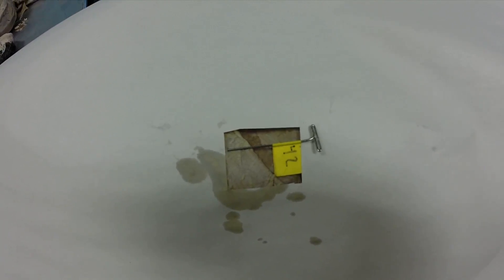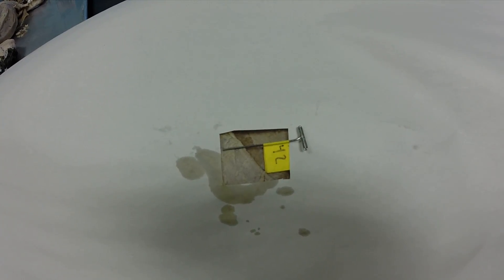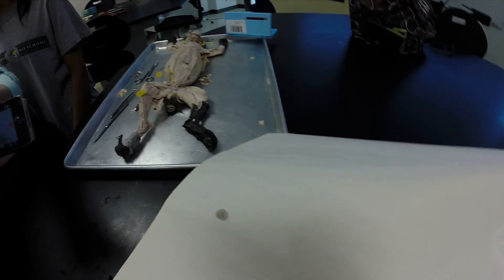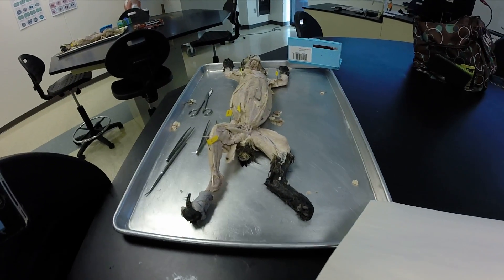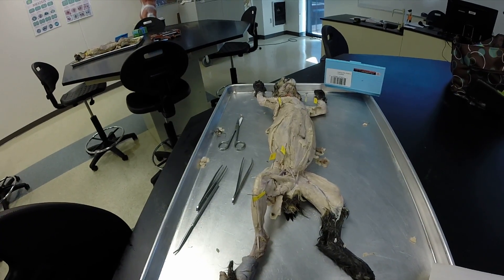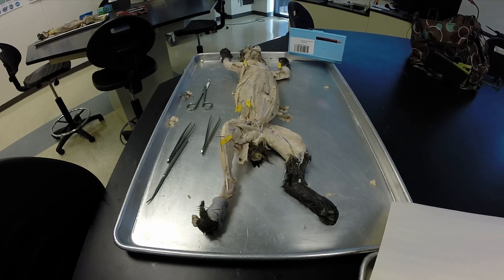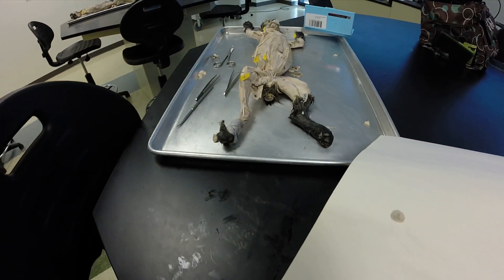What I want to do in this video is give you some practice with the muscles. What I've done is set up a few cats and we're going to go through them. How would you walk up to a station and figure out what the cat, what muscle it is?